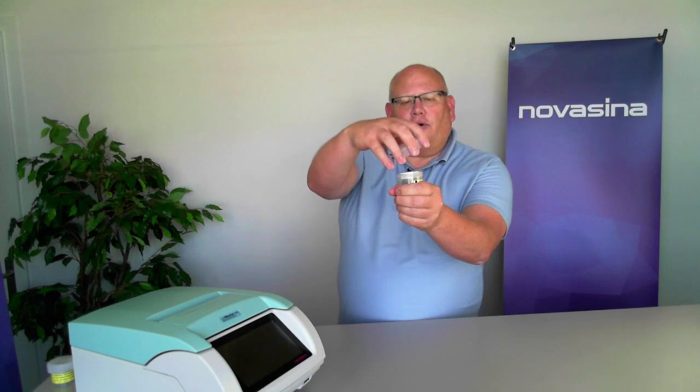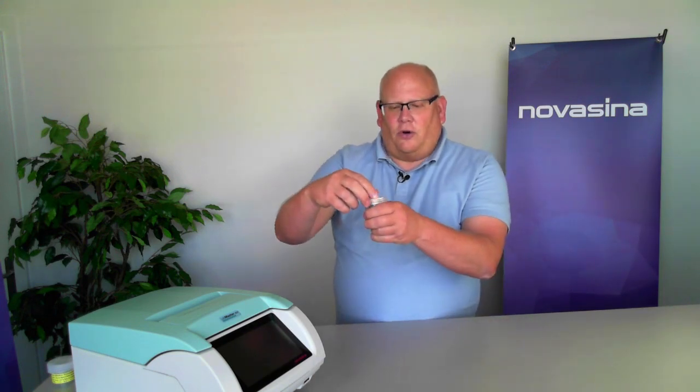Here we have an example of one of the SAL-T standards. Notice that it's stored inside of a container with a screw top on it. When you're going to use the standard, you simply open it up and use the standard. And when you're not going to use the standard and store it, you put it back in the container, tighten the lid down tightly, and then store at room temperature. If you do this, then you will have maximum shelf life for these standards. You can use them for an extended amount of time.